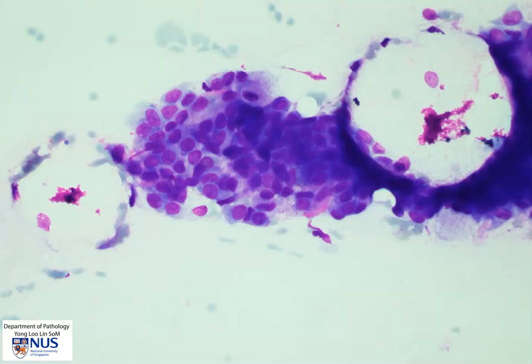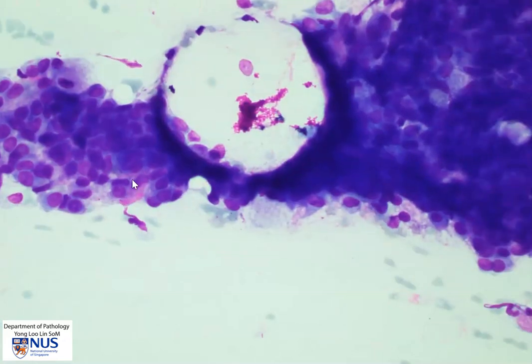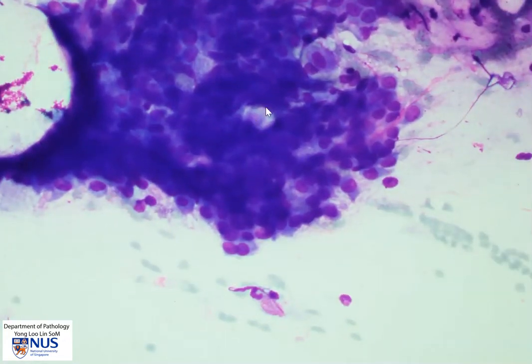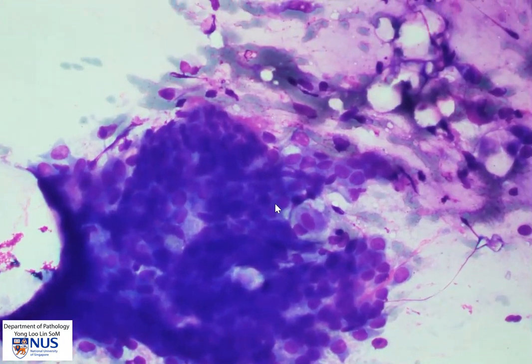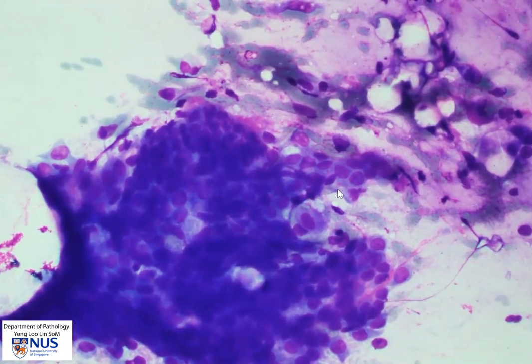Here again is likely a group of intermediate cells. Moving on to other areas where we can see mucus cells with more cytoplasm.